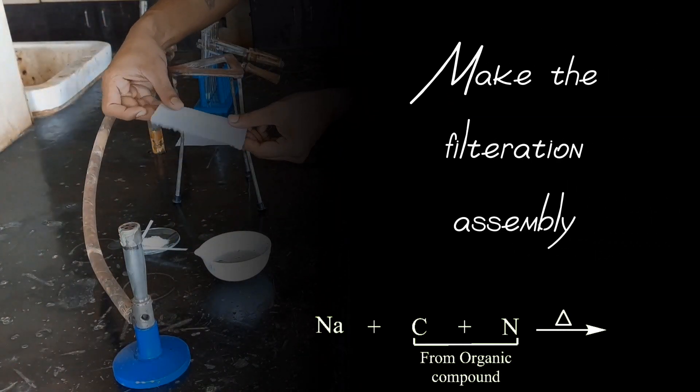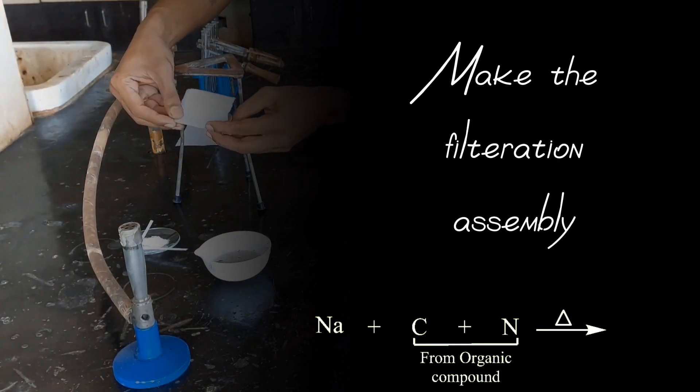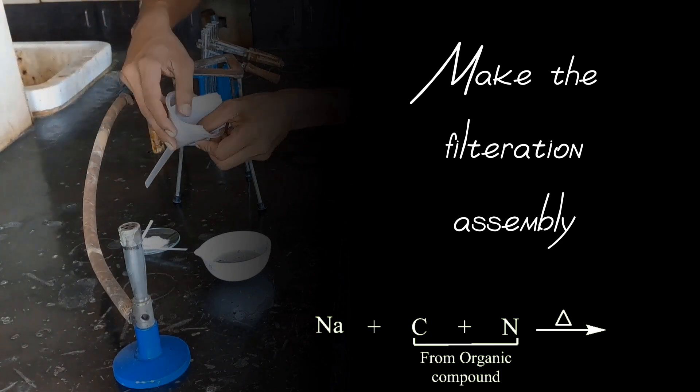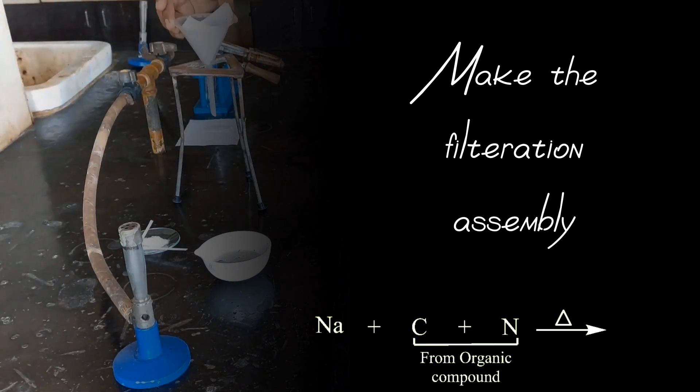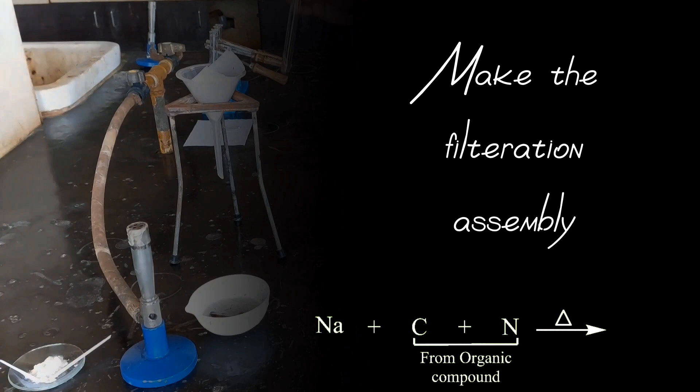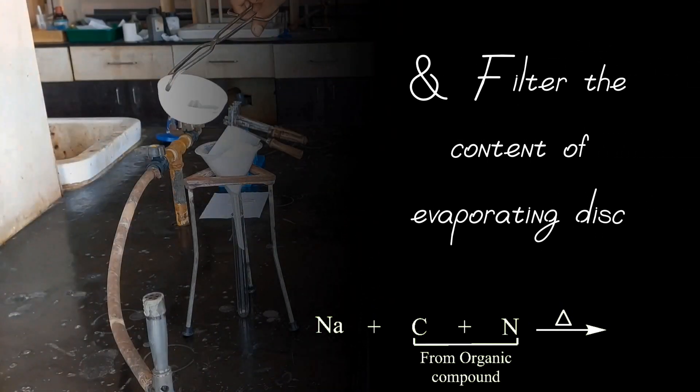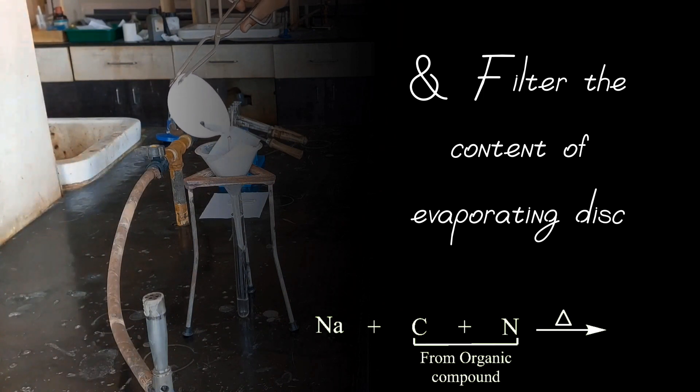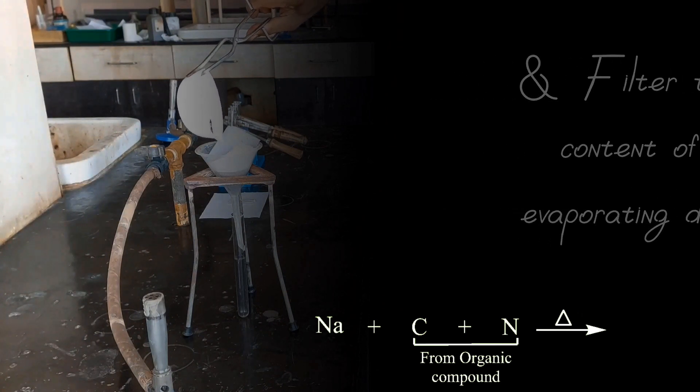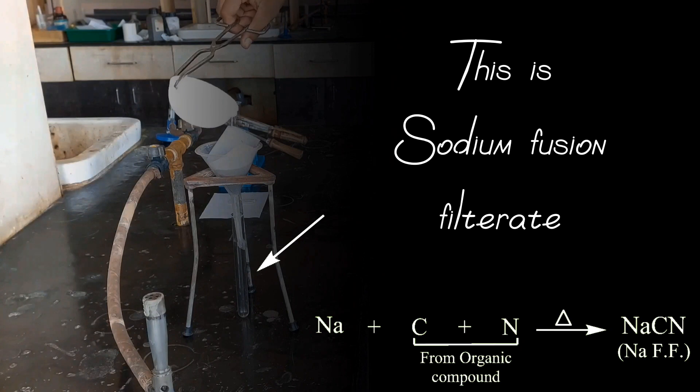Make the filtration assembly and filter the content of evaporation disc. This is sodium fusion filtrate.